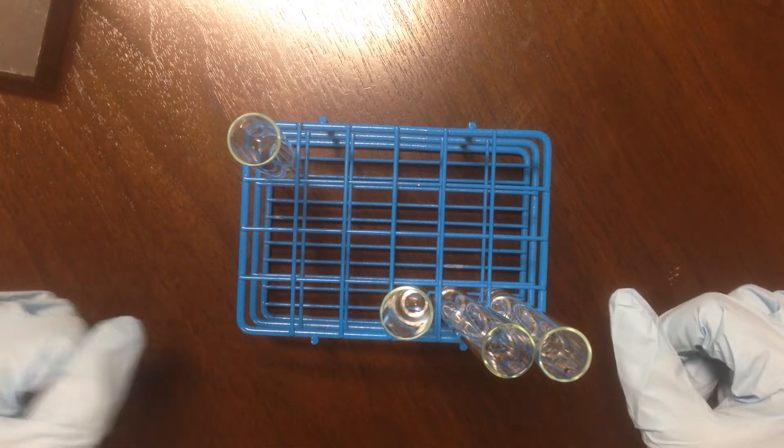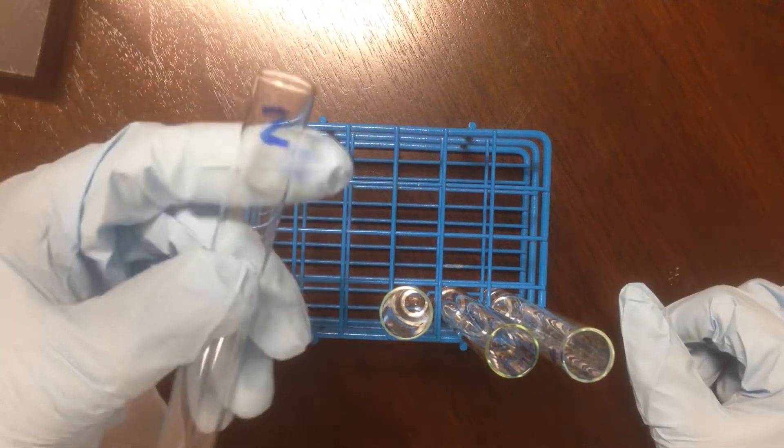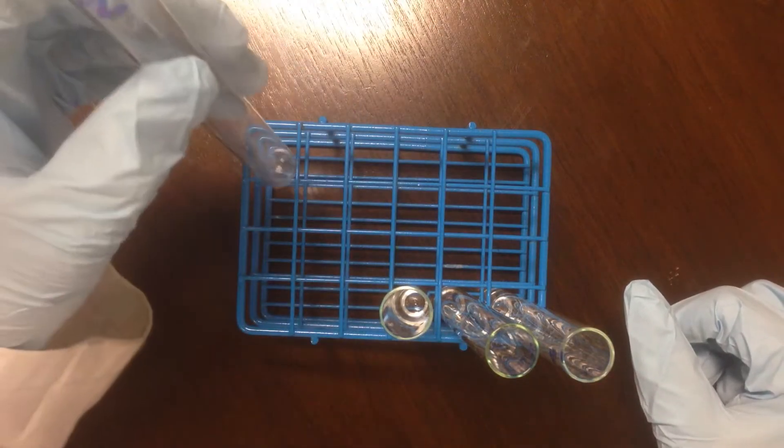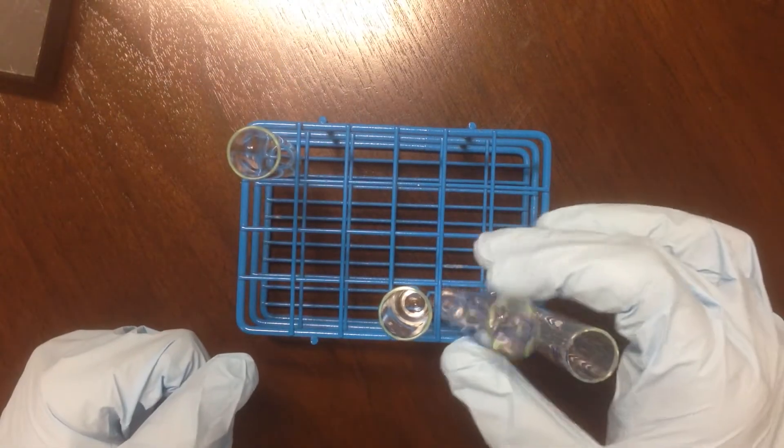Let's prepare test tube 2 from the equilibrium experiment. I have here a holding tube labeled 2. That's going to be my final holding tube for the resulting mixture.